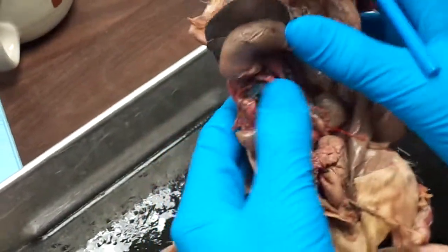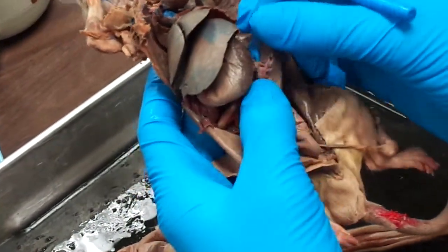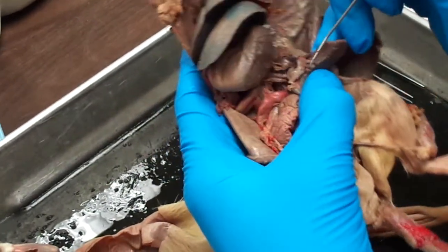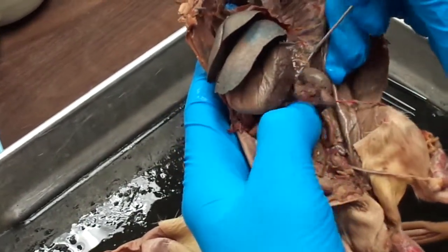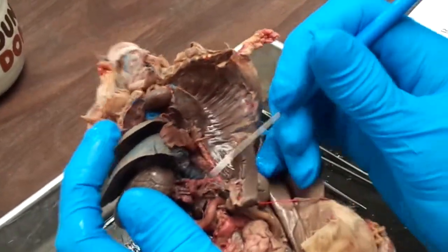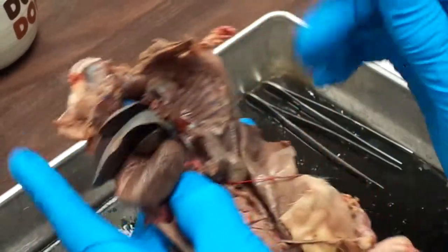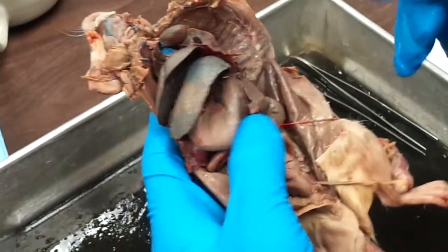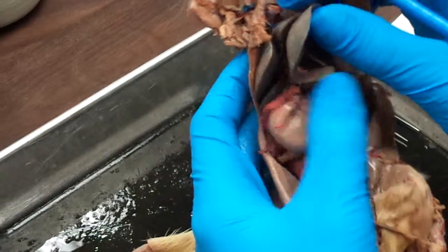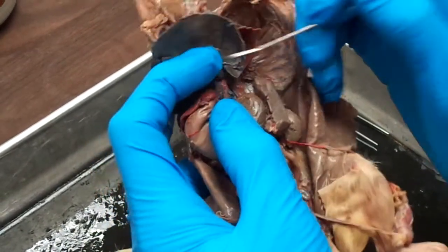The second one is going to be the splenic artery, which if you take your spleen and trace that back, your splenic artery is where all three of these branches are going to meet back up, somewhere in this clump. You can actually see it coming off the celiac artery right here. And the hepatic artery is fairly hard to find because it goes behind the stomach up here to here. So if we pin that one, we will pin it right here at the base of the liver.